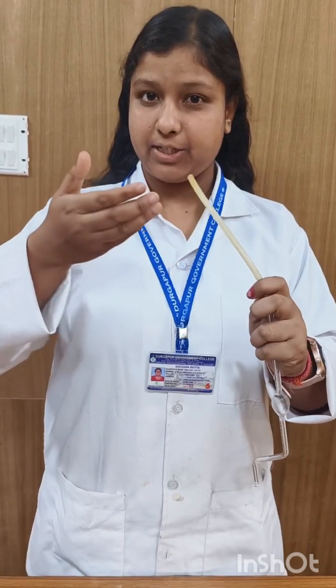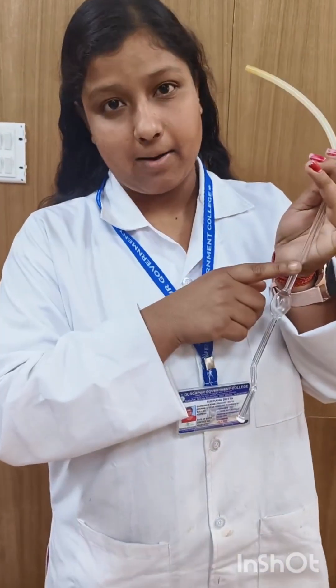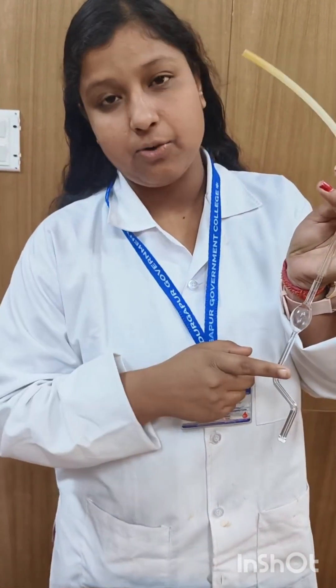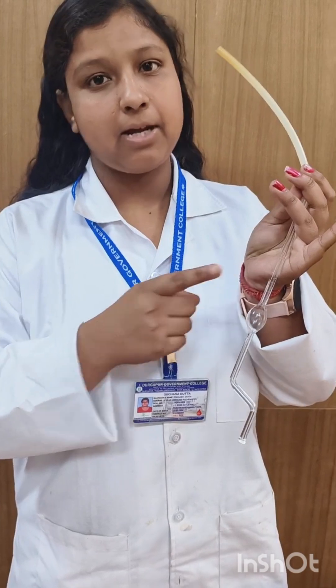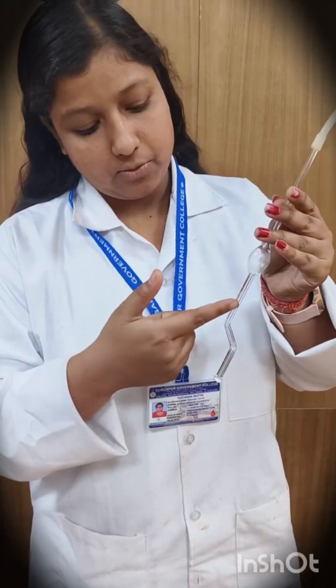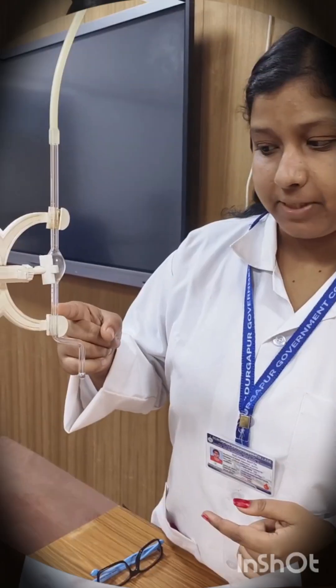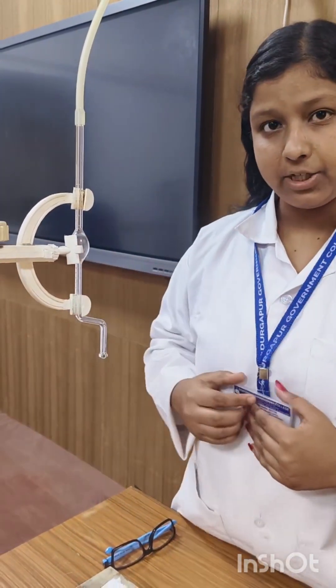Here is a Stalagmometer. There is a rubber tube and a liquid tube. There is an upper mark A and a lower mark B. Between the upper mark and lower mark, there is a bulb. Below the lower mark, there is a capillary tube, where we count the number of drops falling from the capillary tube.